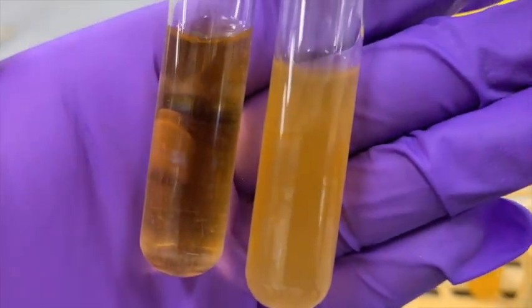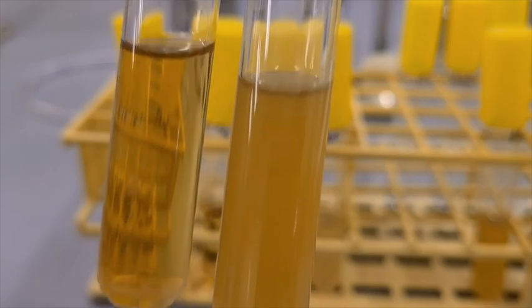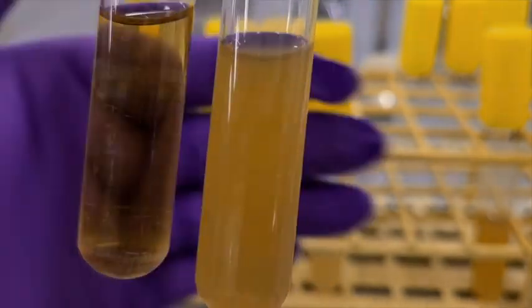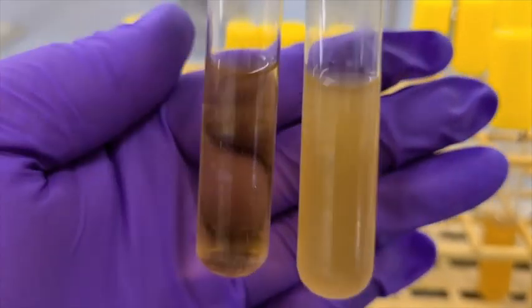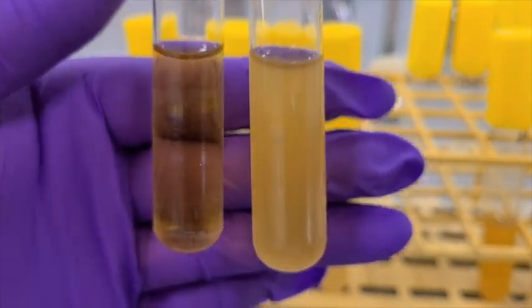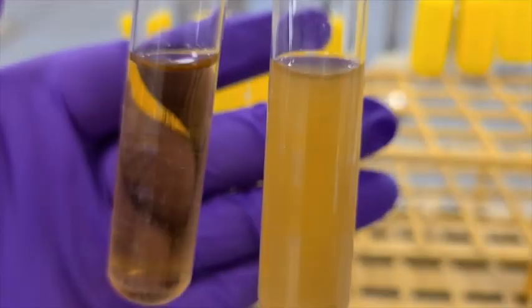Moving on to the brain heart infusion, this is our E. coli on the right and our control tube on the left. We can see thick growth throughout the media, and once again, I can't see my hand through the turbidity. Now this is our E. faecalis on the right in the brain heart infusion, and our control tube on the left. In this one we can see growth. And then finally here is the Staph aureus in the brain heart infusion.